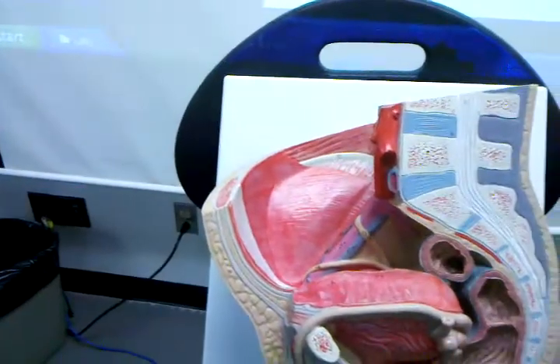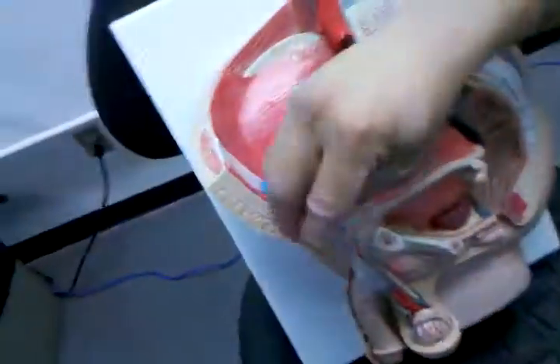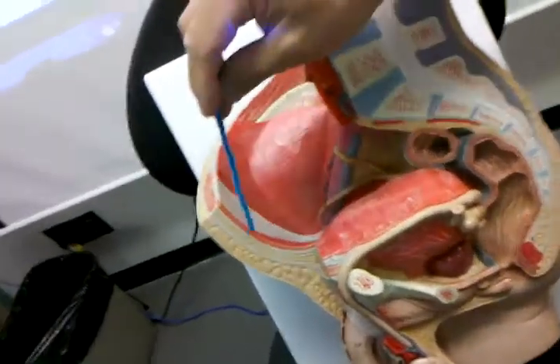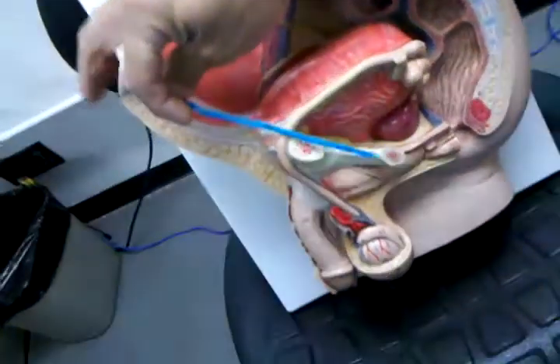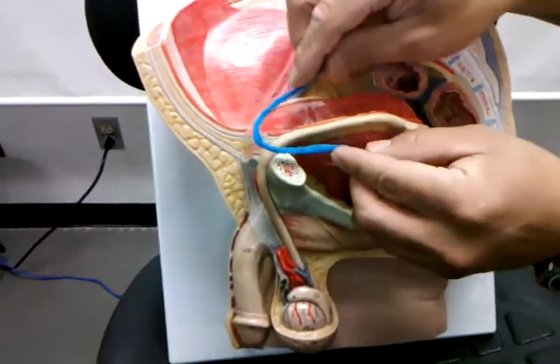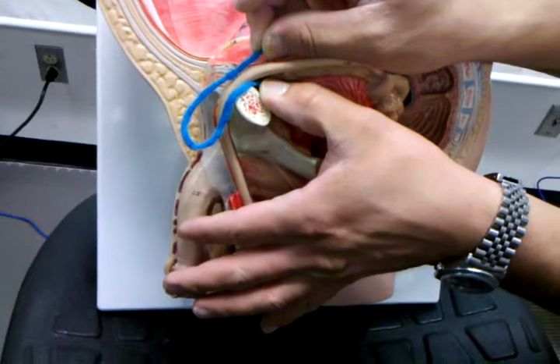Right? Now, once we get all the way through the body wall muscles, we still have one more layer which is lining the body wall. And that layer which is lining the inside of the body wall is the peritoneum, which is a layer of serosa. It's a single layer of serosa. Now, what happens is that serosa was originally lining the inside of the body wall here, and then when the testis pushed its way out of the inguinal canal, it took a layer of serosa together with it like this. It actually pinched off the serosa and pulled it out of the inguinal canal together with it.